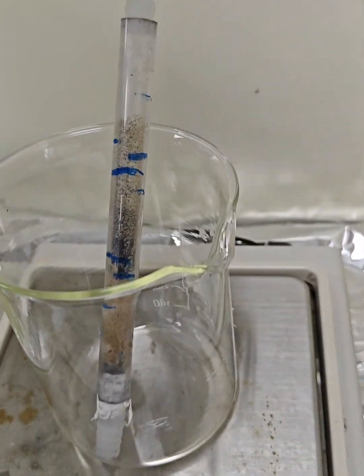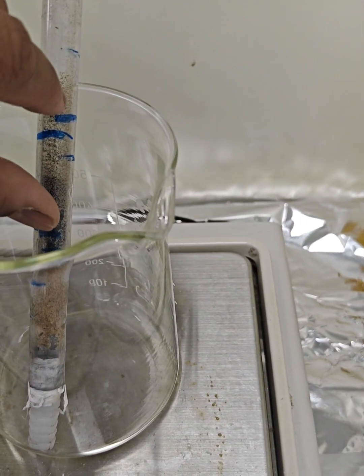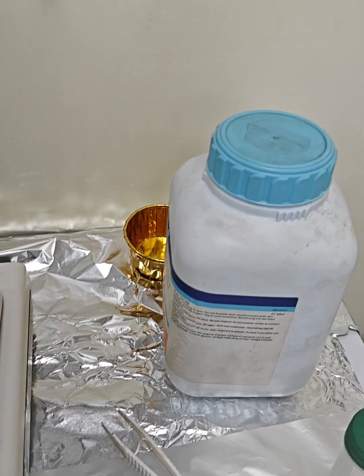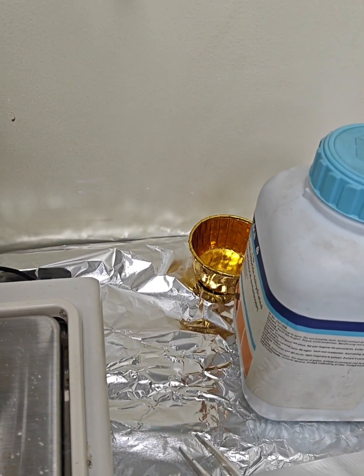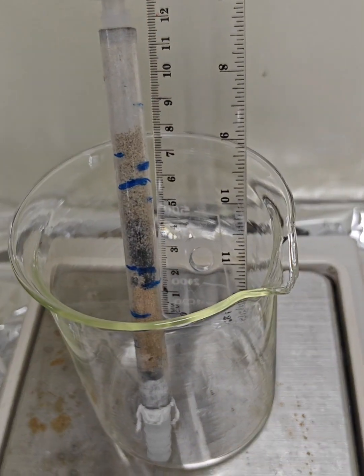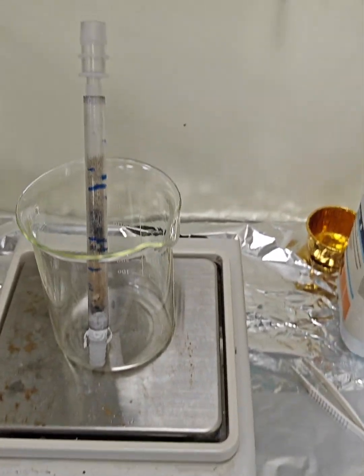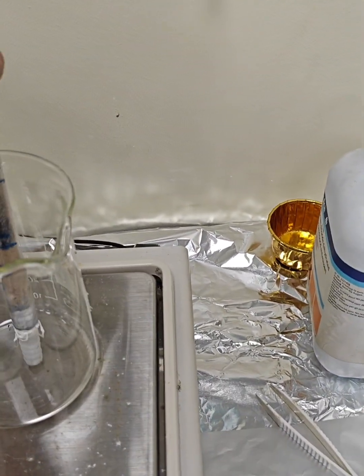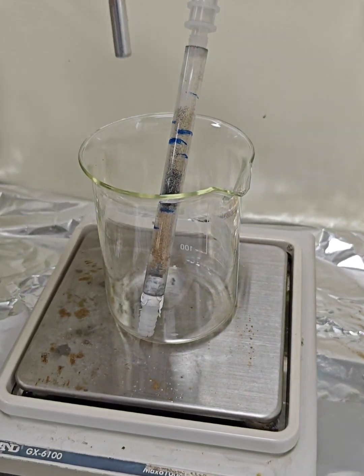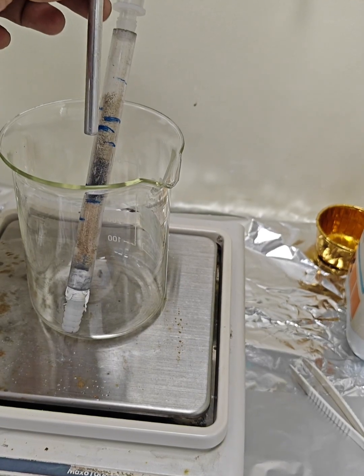Now we are adding here till this mark. This mark from this is around 5 centimeter. With the scale you can see that from this marking, this is till here. This is 6 centimeter, you can see clearly. Now we will keep adding the mass till this mark, and also push with this rod to make sure there is no void, because usually these are lighter particles, not like sand, which is denser.